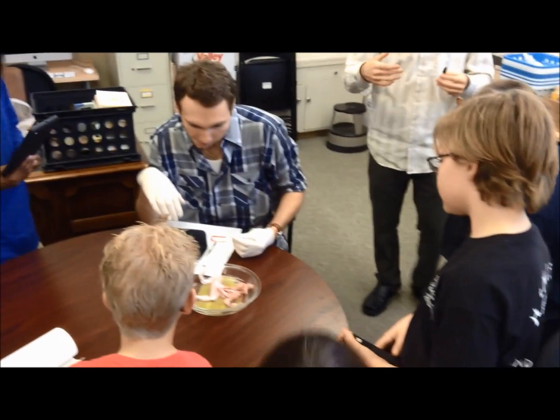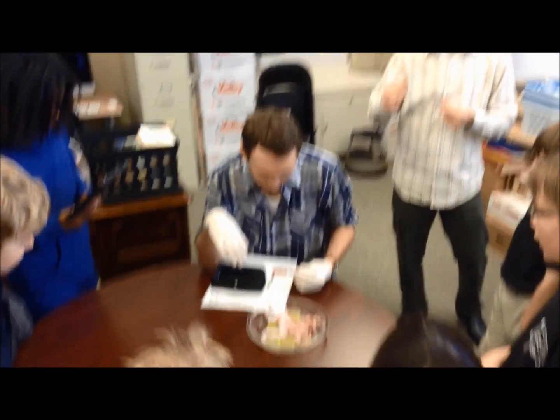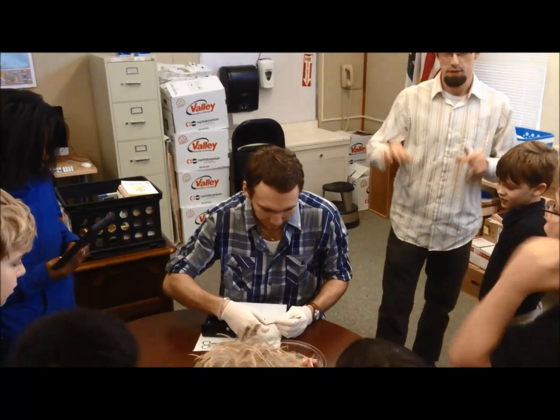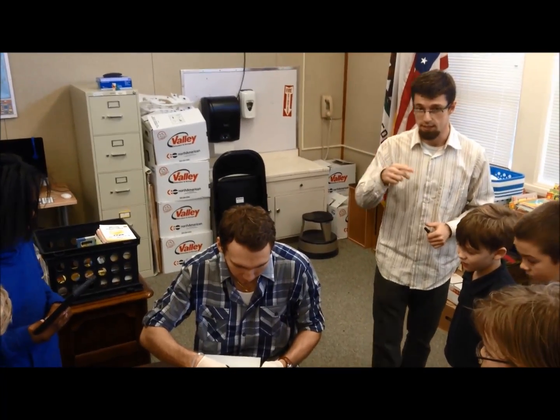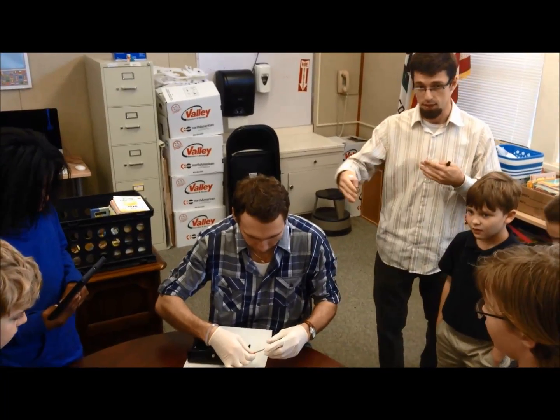The reason why Serge is going to dissect it is because he needs to get at the main nerve — it's called the sciatic nerve. So if we were to just take our electrodes and hook it right up, it might not work that well. But if you can get at the actual nerve, we'll saturate it with the calcium solution. Remember how I was saying that in order for the signal to transmit, there needs to be calcium ions that flow through that axon.